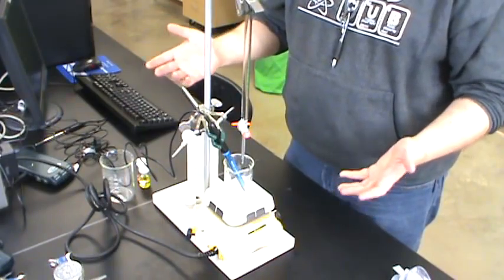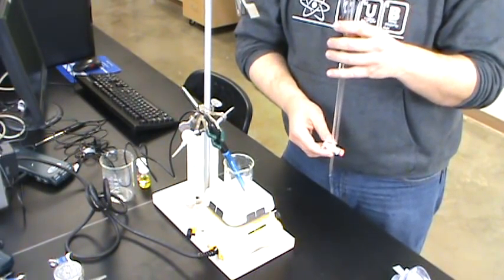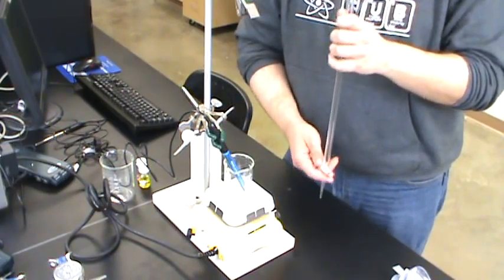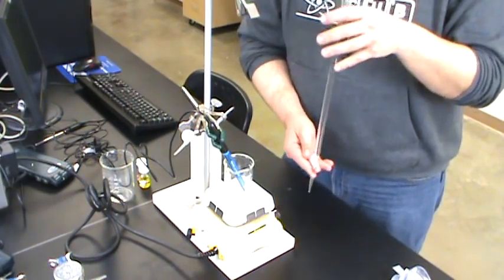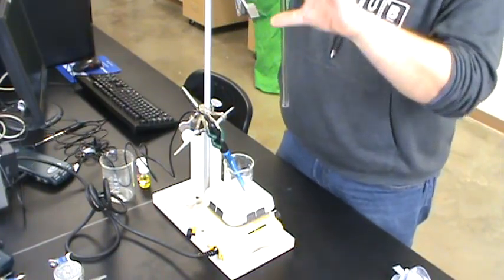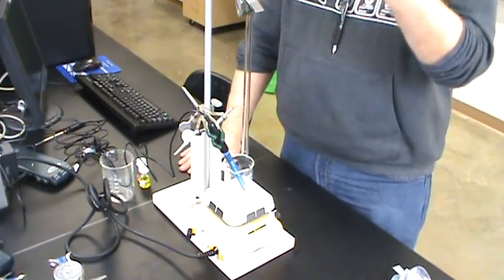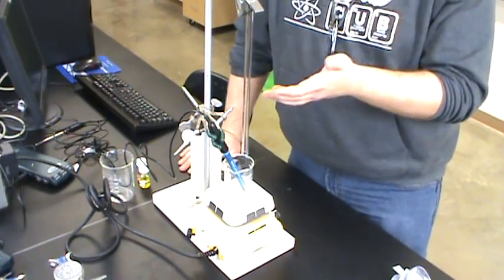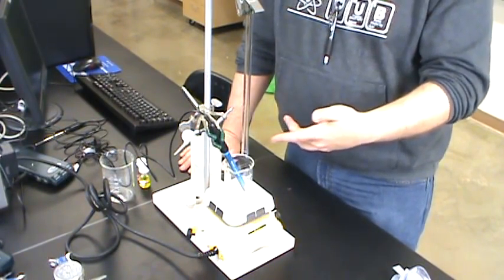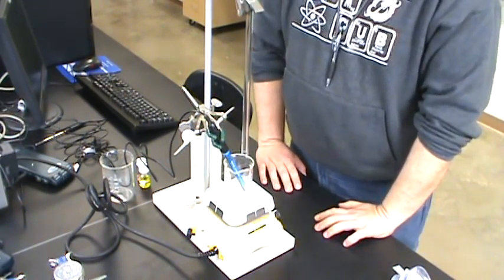When you're completely finished with your experiment for the day, take the burette off the stand, drain it out completely, and give it a rinse with good deionized water. To stay consistent about who's doing what and where, mount these burettes with the stopcock open and upside down in the stands for the next class. That way the next person will see it and hopefully trust that you rinsed it out, and it'll have a chance to dry sitting upside down with the stopcock open.